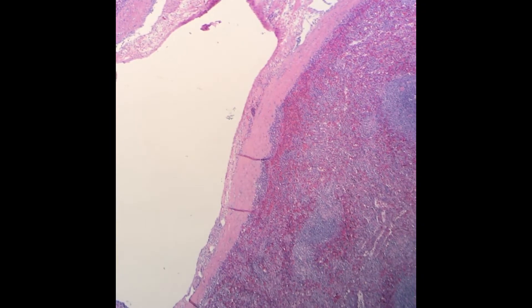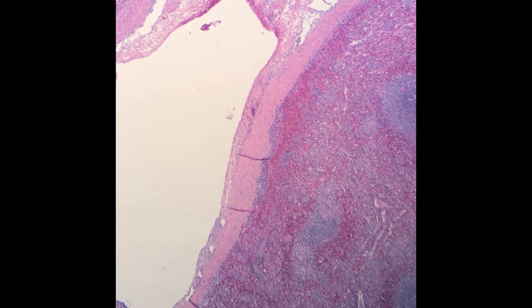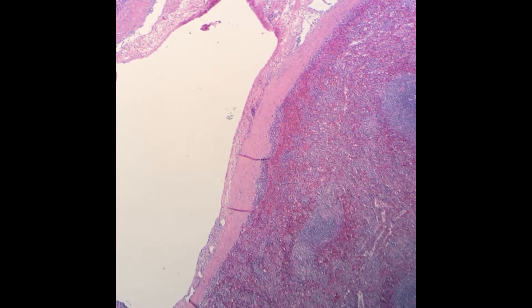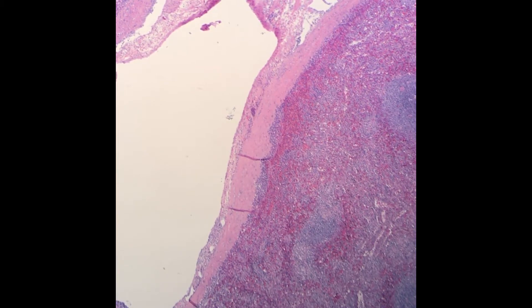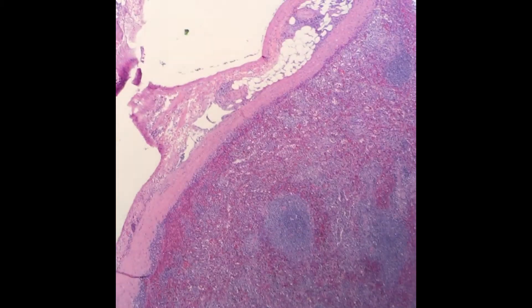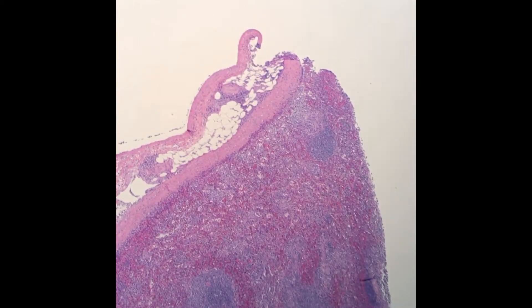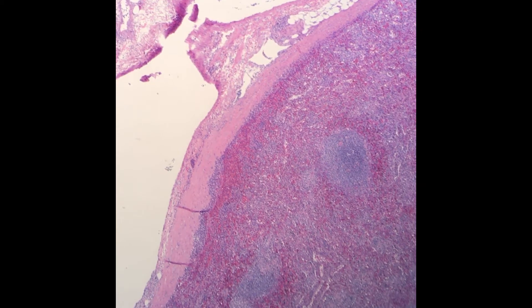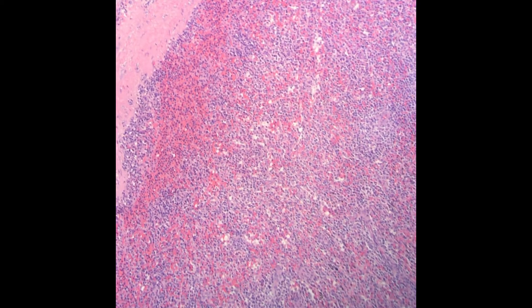In the next few minutes, I would like to briefly go over a case of autoimmune splenitis as a way to introduce my approach to non-neoplastic splenic lesions. With any organ system, the first order of business is to exclude the possibility of a neoplastic process. In order to do that in the spleen, you need to understand the anatomy well enough to know when it's either effaced or sufficiently preserved.